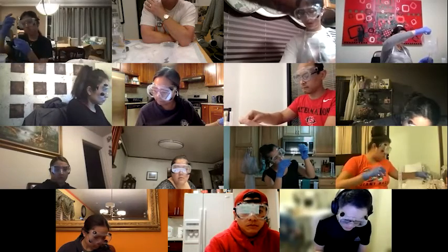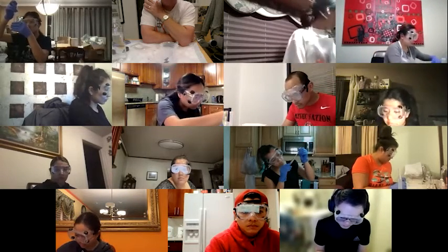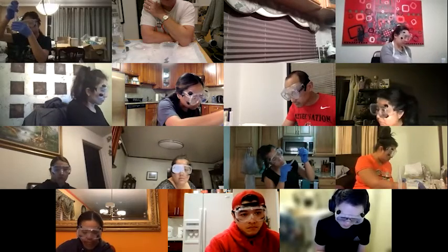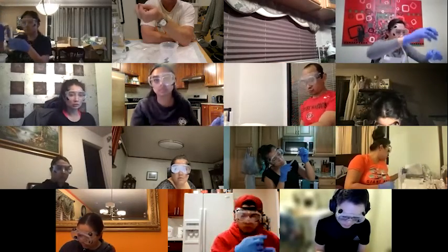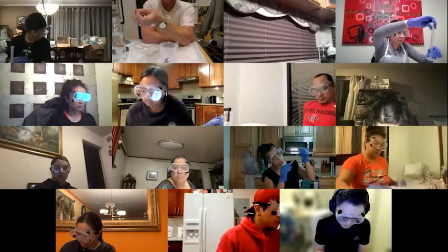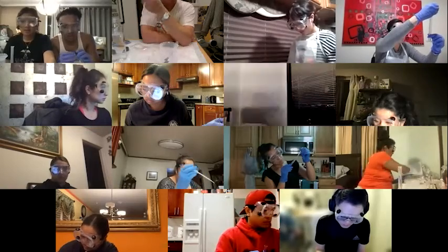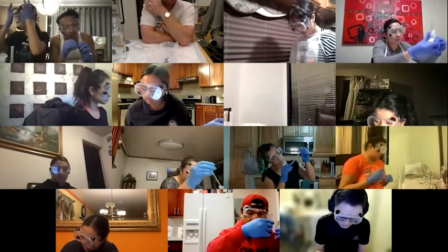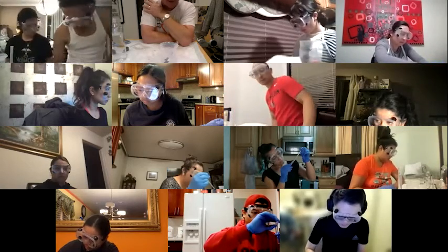This is the same reaction we do when we're trying to determine the gas constant, R. There's another experiment that we did last term with my 210 class, where we measured the amount of magnesium very precisely, and then produced gas from it, calculated the volume of the gas that was produced, along with what the pressure was and the temperature, and we figured out the value of R. It's a really good experiment. It works pretty well.